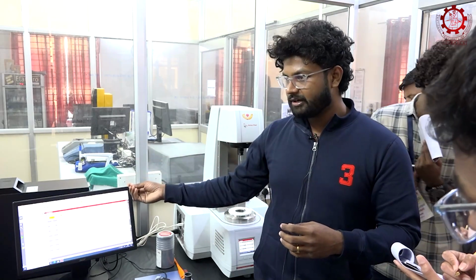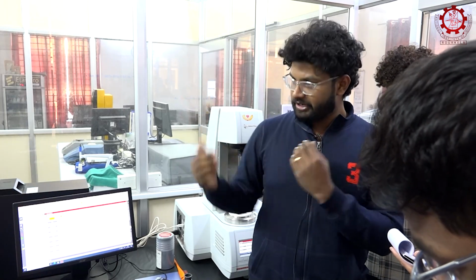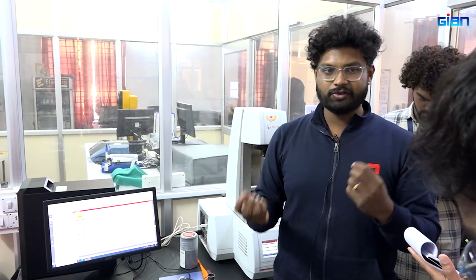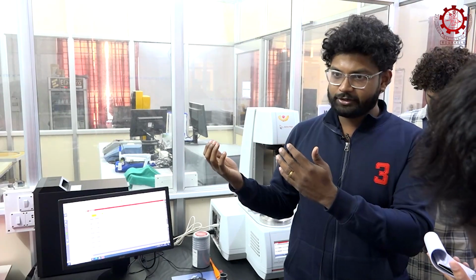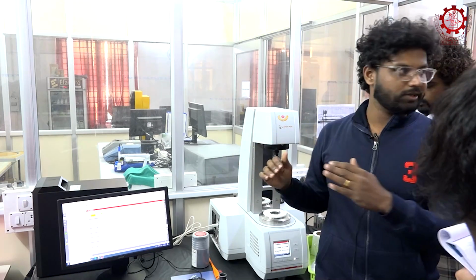Once we give start, first it will go to 50 degrees Celsius. At 50 degrees Celsius, it will stay for 1 minute. Then once we give heat, from 50 it will go to 95 degrees Celsius. At 95 degrees Celsius, it will be maintained for 3 minutes. Then from 95 it will come down to 50 degrees Celsius, and at 50 degrees Celsius it will be maintained for 2 minutes. It will go up and come down. This is the procedure, what will happen.